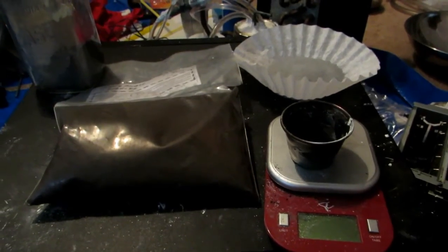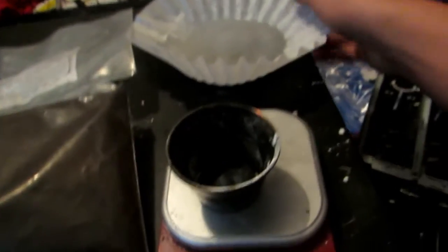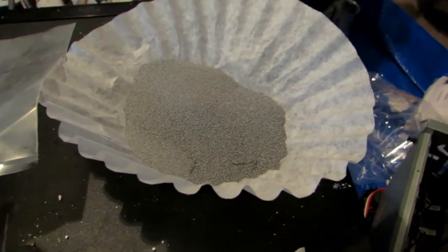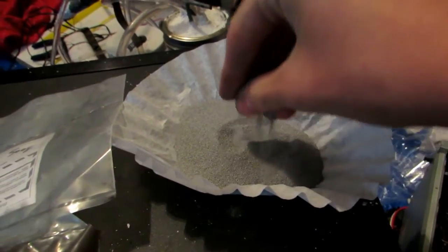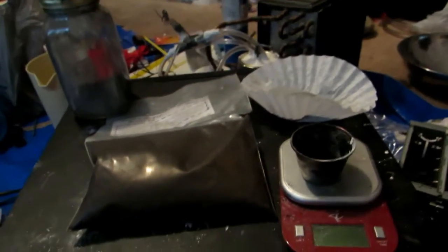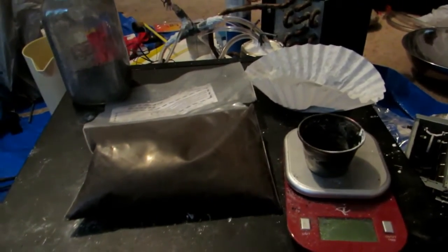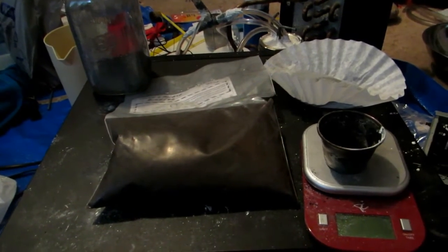Today we're going to be revisiting this, except we will not be using the extremely fine aluminum powder we made in a previous video. We'll instead be using something else because that is so reactive. Quite by mistake in a previous video, I was meaning to make super fine ultra-fine aluminum powder quickly using a coffee grinder, but instead we were left with a rather fine, sand-like material — very finely powderized aluminum, but you could clearly see the grain size. It's not exactly what we need for most thermite reactions, however it's perfect for high-energetic thermite reactions such as the reaction of manganese dioxide and aluminum.